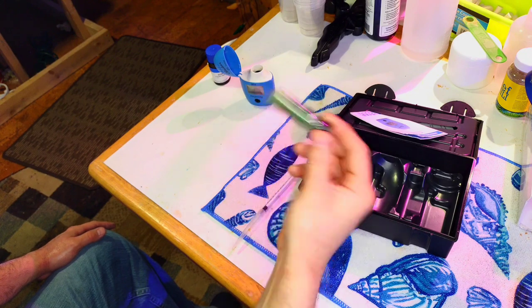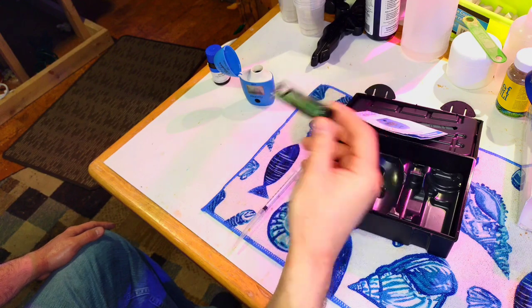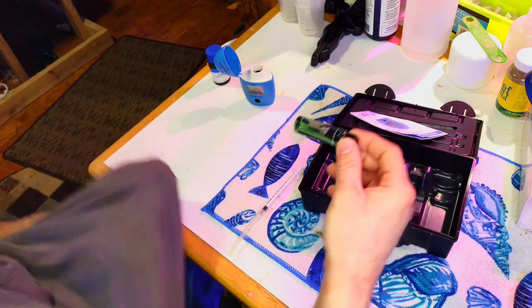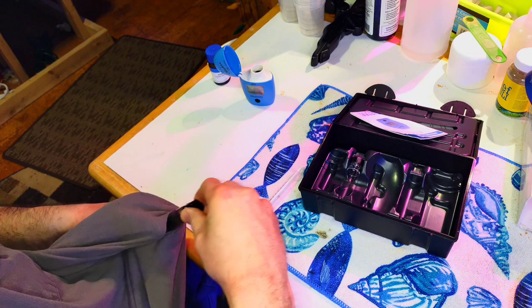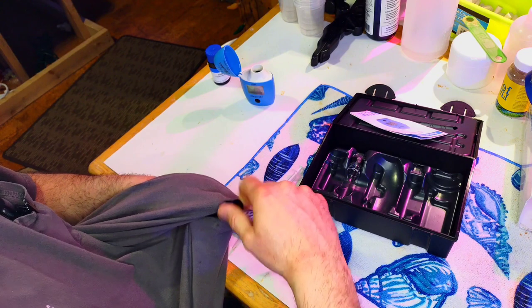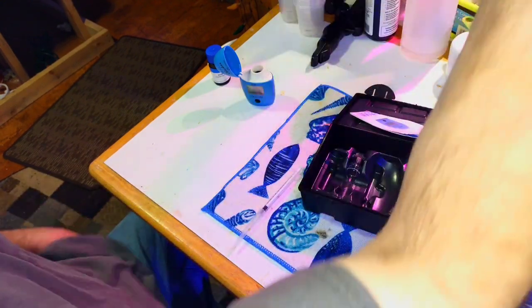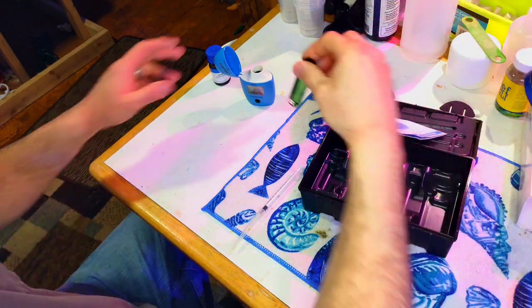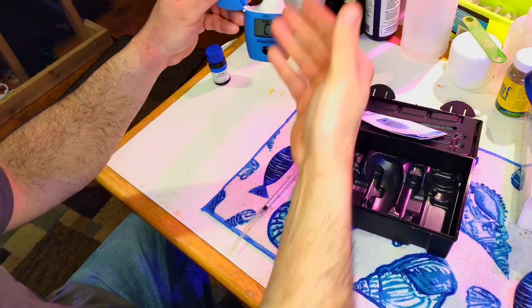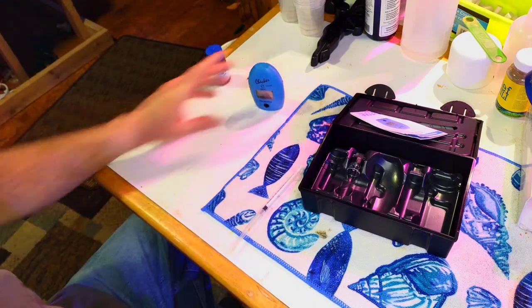The instructions say to invert the vial five times — you don't want to shake it and introduce air bubbles. I actually do it a few more than five times. Once again check for hair or smudges and wipe those off. Hold it up to the light to make sure it's clean, then place it in the reader with the 10 milliliter mark facing forward so it's in the same position as before, then hit the button.